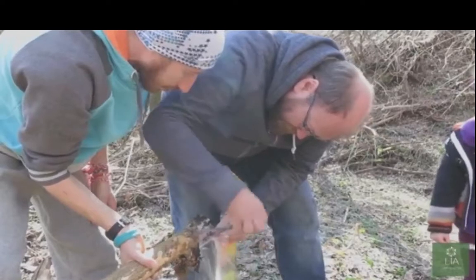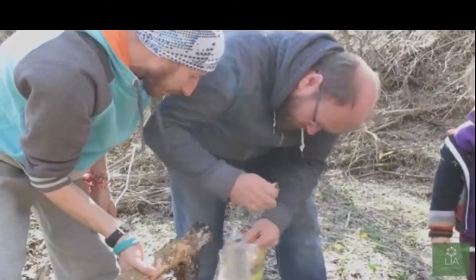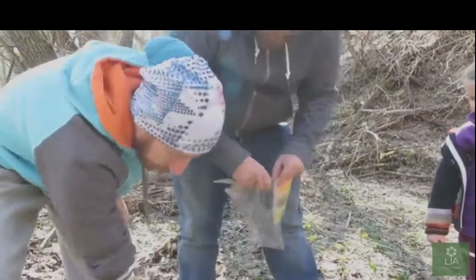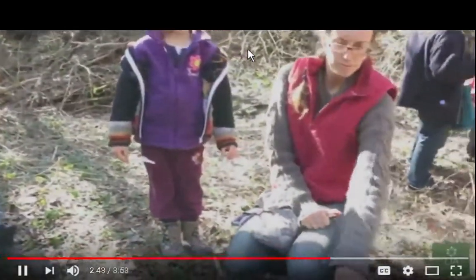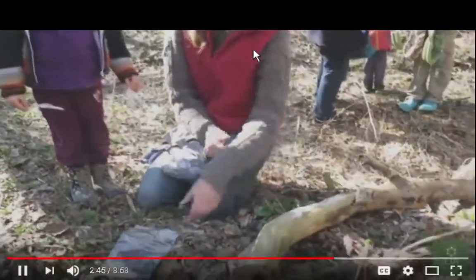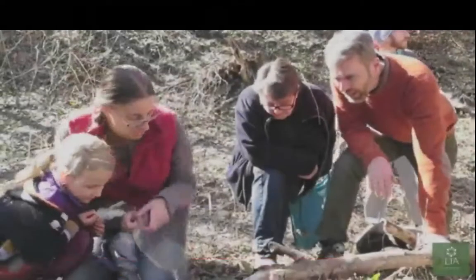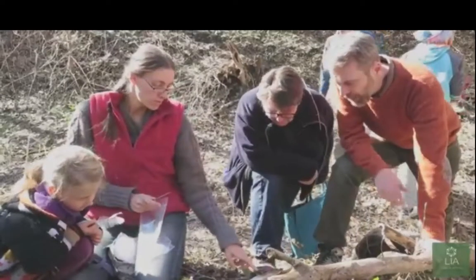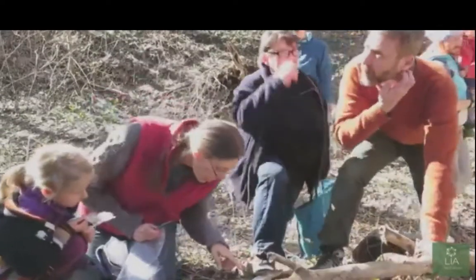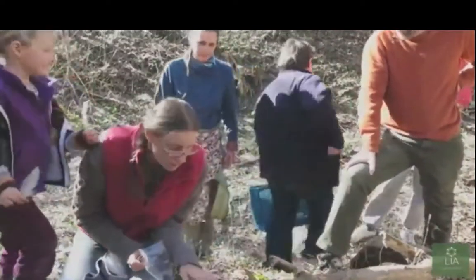Now it'd be interesting to note if you could grab mycelium like that and just put it in a dish and grow it right from there. He says something about handling it with his fingers, and he's put it in a plastic bag which may or may not have been sterilized. So is sterilization important if you're not planning on eating any of the mushrooms? So where best to take from?